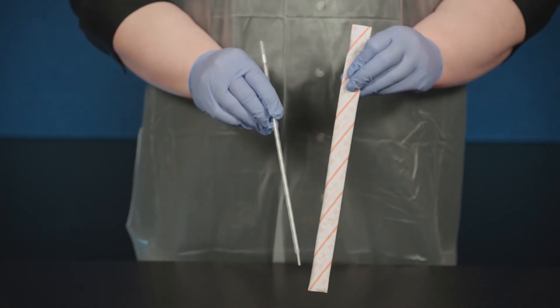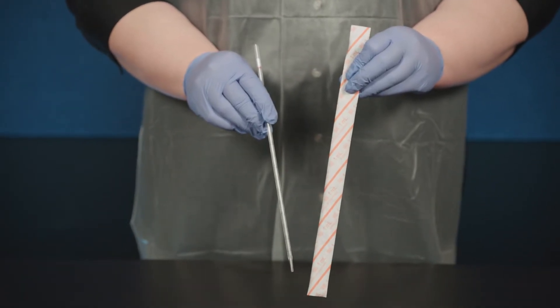Pipettes are used for transferring liquids. There are a variety of different types of pipettes.